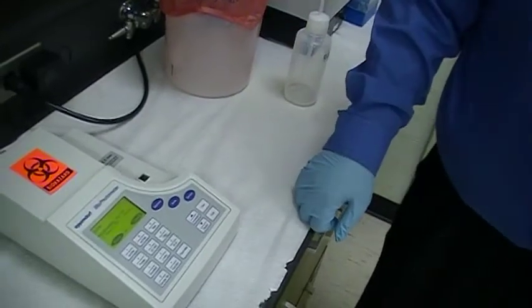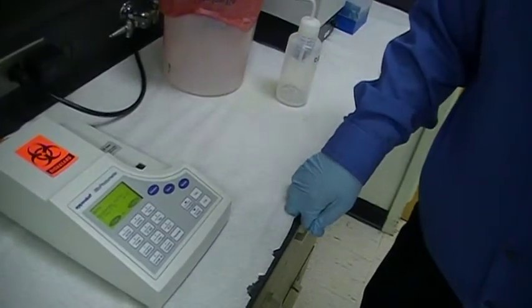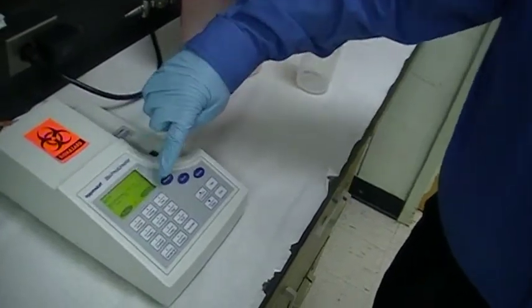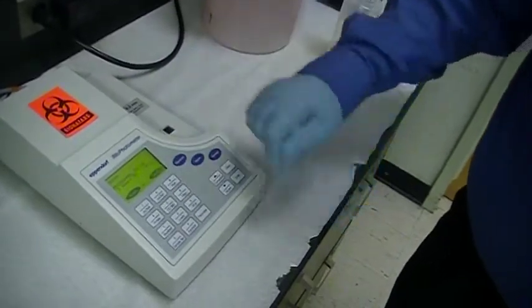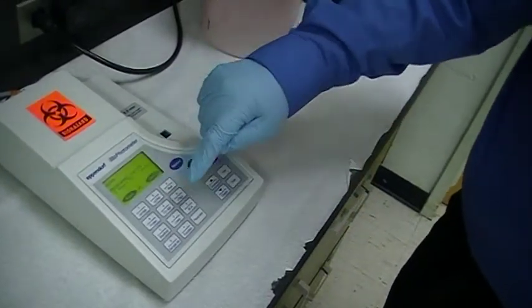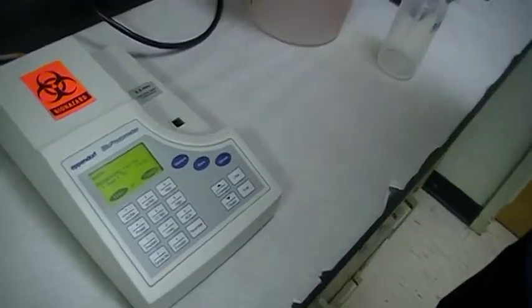Okay, so now it's ready and this one just happens to be our DNA calculation and you can see that they have different programs on here for double-stranded DNA, single-stranded DNA, RNA, you simply press the button that you are going to use and then protein right here.